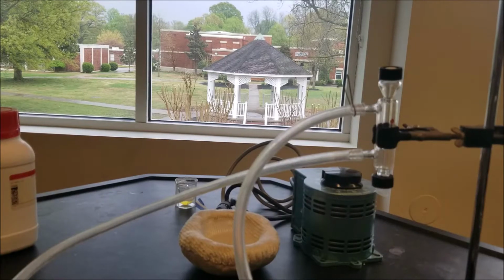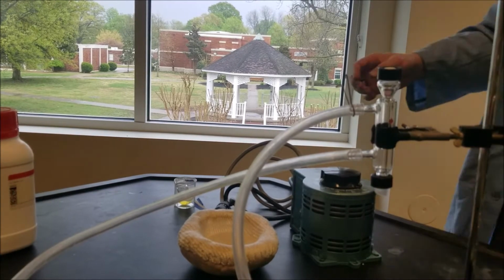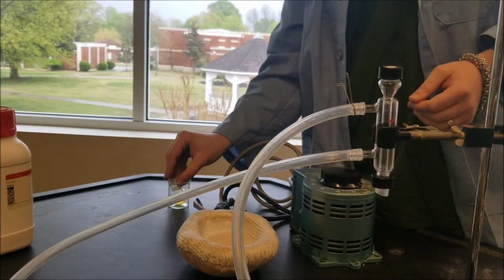At this point, I had added 2.2 molar base and a boiling stone to the solution, and I was ready to start. I'd have a video, but unfortunately the camera was shifted and it was all off camera. Oh well. Now I'm setting up my distillation, well, my reflux apparatus.